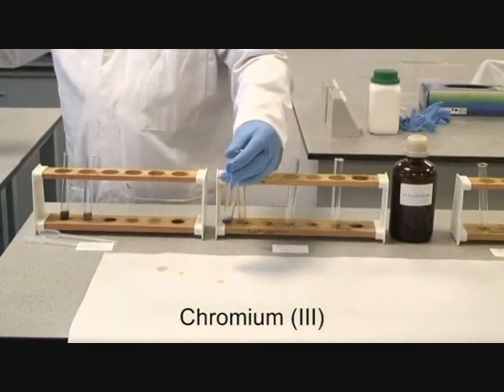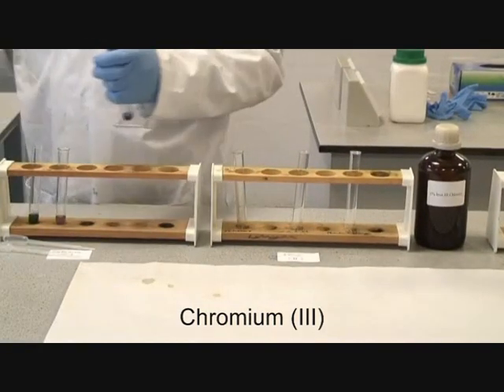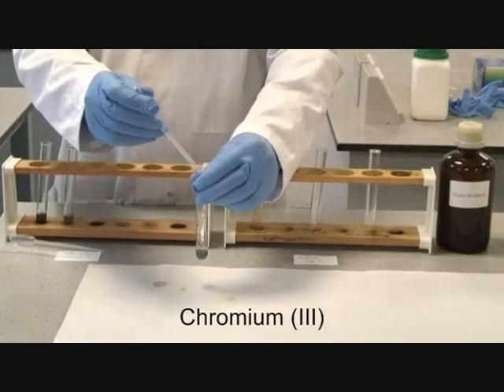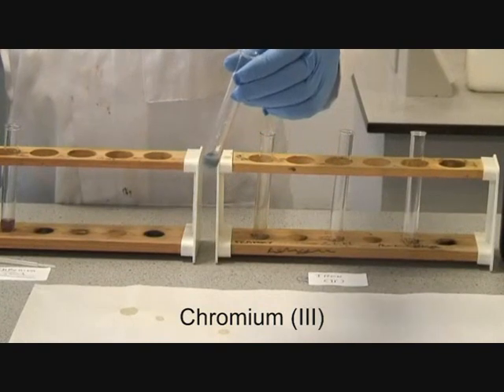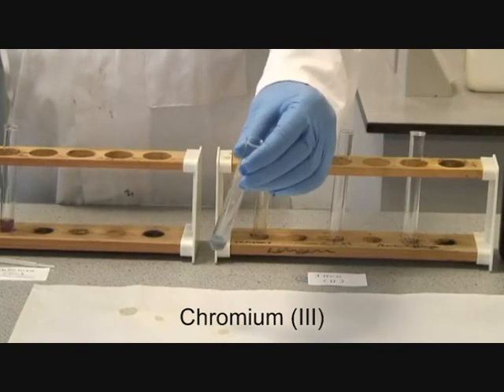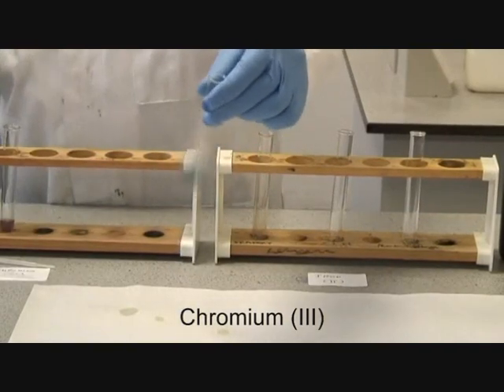The third ion we're going to add is carbonate ion. This is a one molar solution of sodium carbonate. We'll add this drop-wise to the solution and see what happens. You can see that effervescence initially occurred, and again the solution has taken on a dirty green-gray colour. Adding more carbonate has no effect.